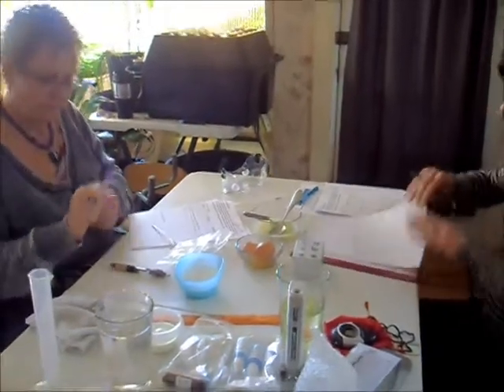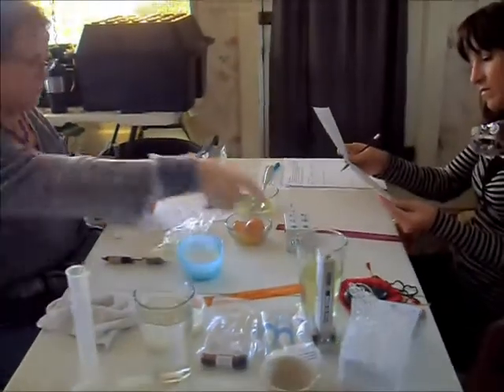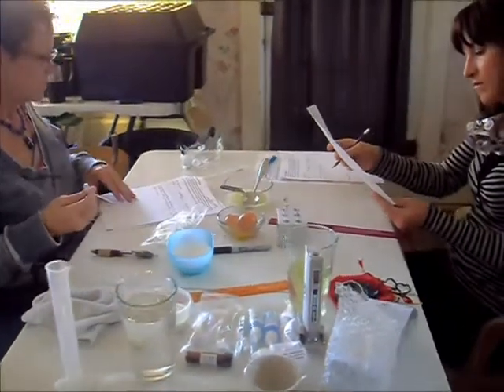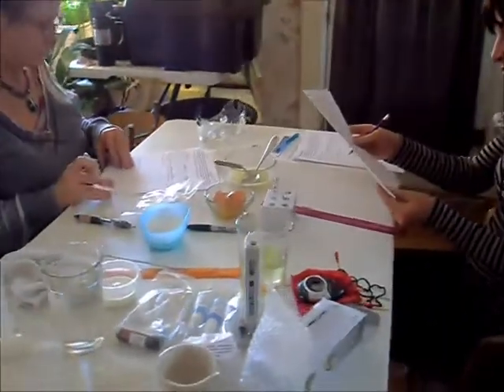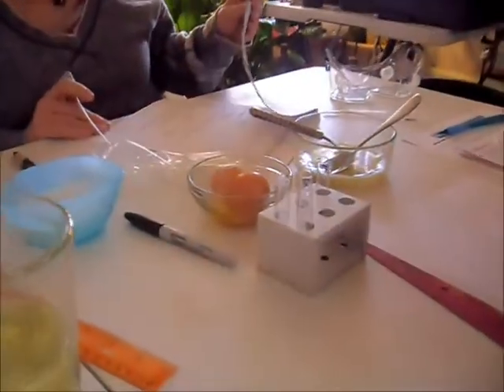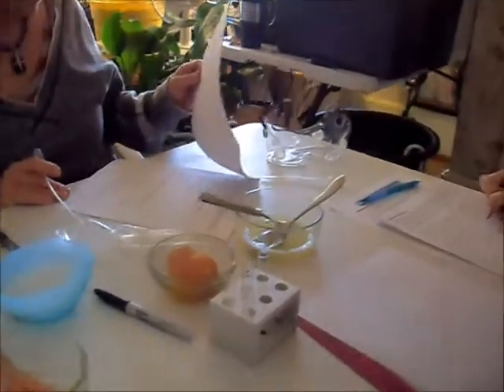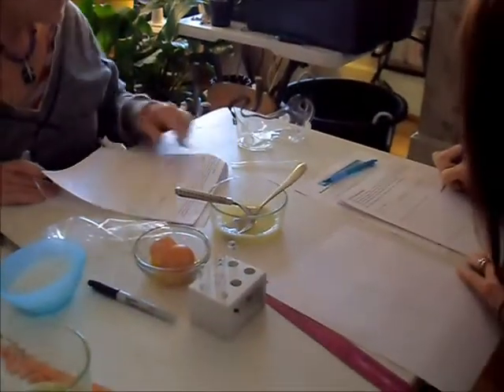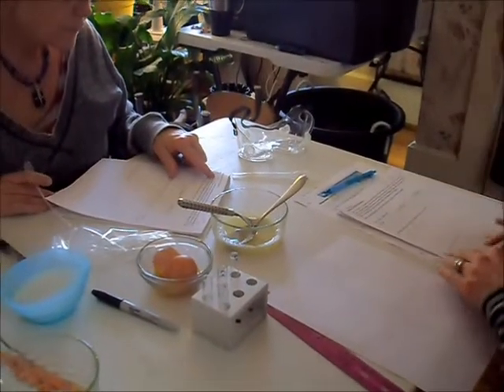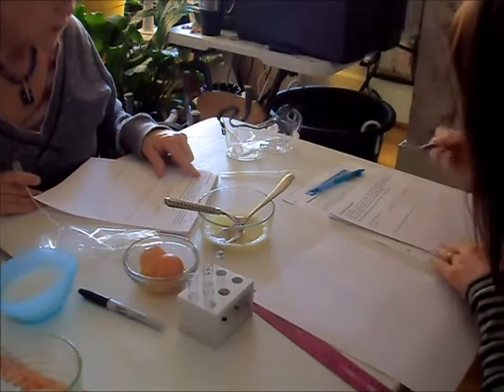Right now Melanie and Cindy are working through the methods. You can see that they're preparing their test tubes with the substances, and they are also taking notes in their lab document. They're actually writing down the methods as they do it.